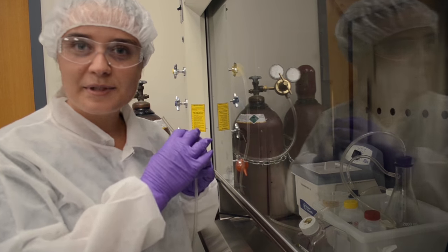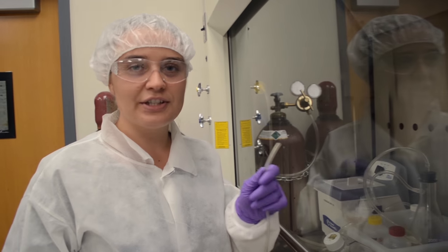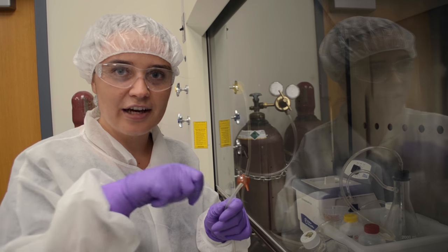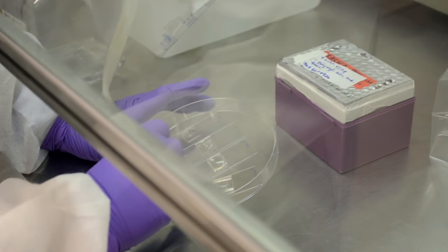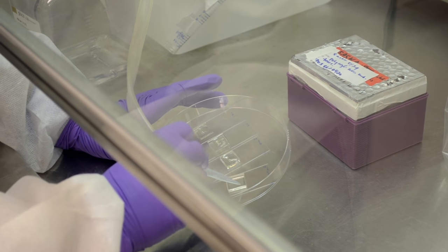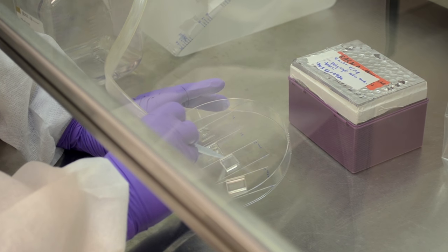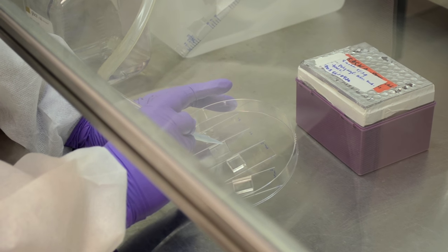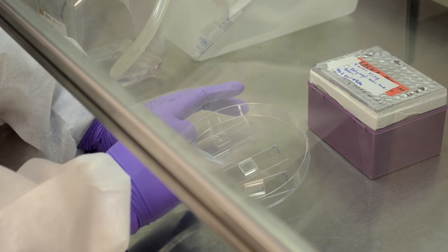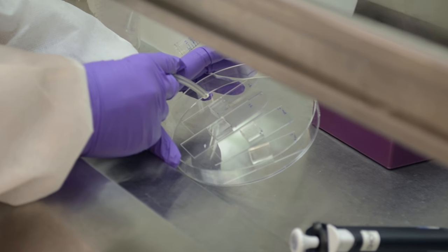We're gonna dry the stamps by vacuuming around the stamp. And then we're gonna make sure that they're really dry by putting an inert gas on top, it's like the hair dryer for the stamp. So this is called aspirating, which I think is one of those funny words. It's like, why don't people just say take liquid off? And I'm trying not to touch the middle of the stamp because that's where the features are. That's where the pattern is. And then just aim there. And you can kind of see it dry.